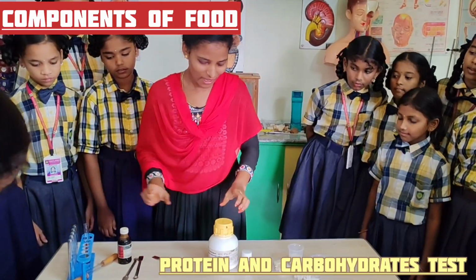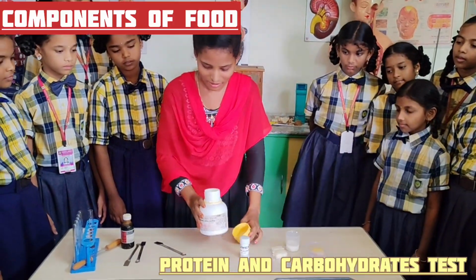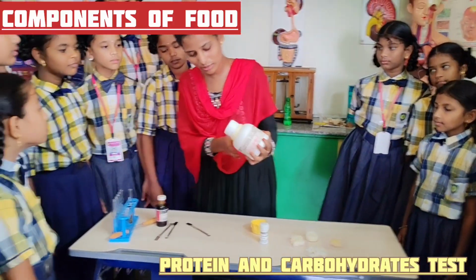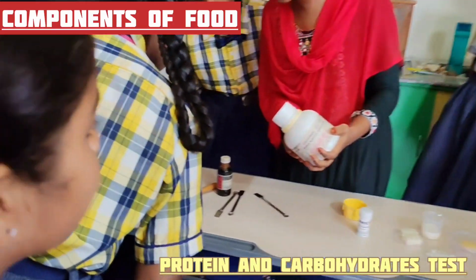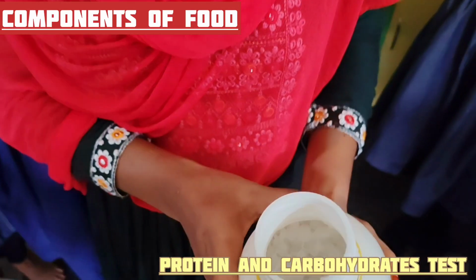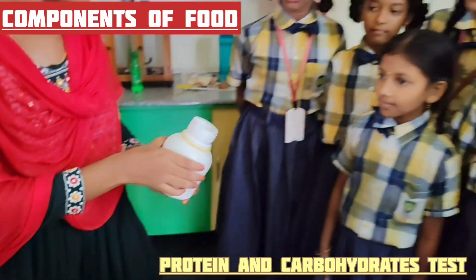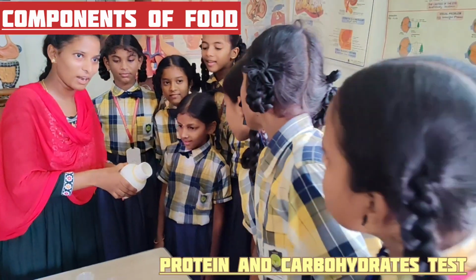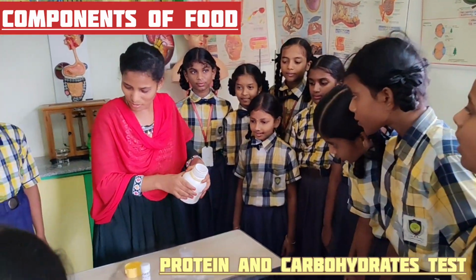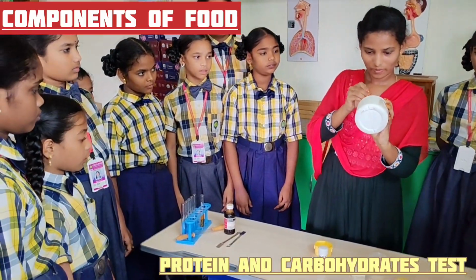Okay? Then we have to prepare sodium hydroxide solution. Once observe how the sodium hydroxide is. It looks like crystal. It is in the form of crystals and it is white in color. These are the sodium hydroxide pellets. Okay. Now I will take a few pellets into the test tube.